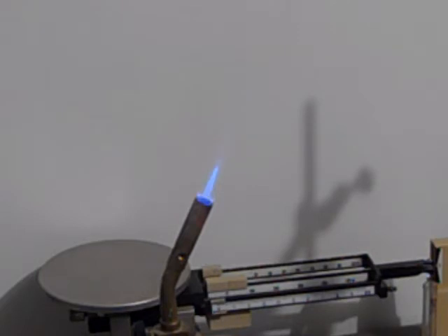There's not too much calcium. It hasn't dissolved too quickly. It should be sort of a yellow-orange. Yeah, that's the calcium. See it?